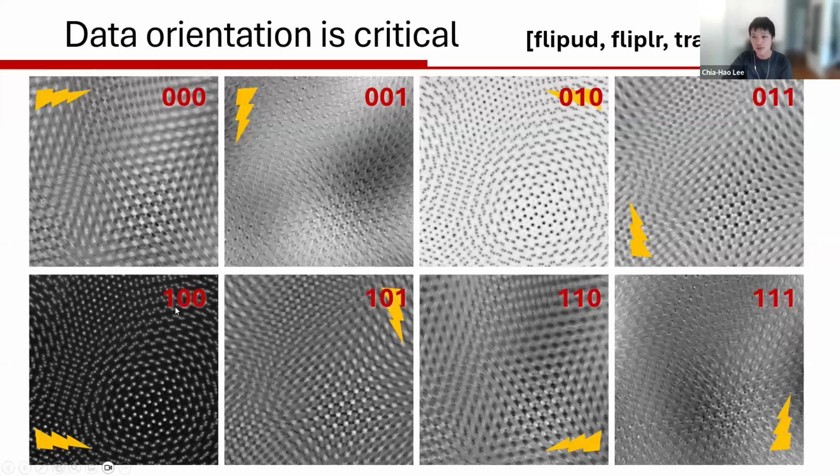So this 100 means that I'm flipping only up-down. If you change the orientation of your diffraction pattern, you do get something with the same sort of crystal structure. However, the contrast is totally wrong. And if you have a 180-degree rotation, in this case you flip your diffraction pattern upside down and then left to right, then you are actually going to get an inverted reconstruction. These two are mathematically equivalent to each other, except that your phase is moving. Instead of having a positive phase shift, you're getting a negative phase shift.